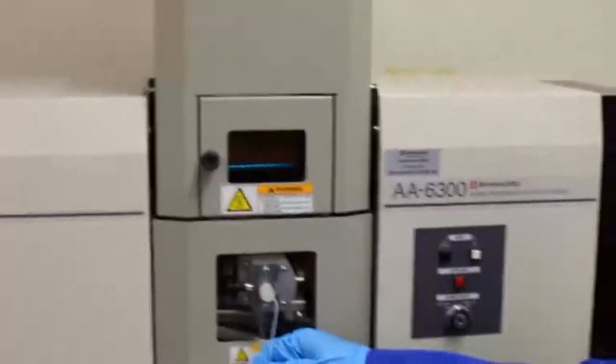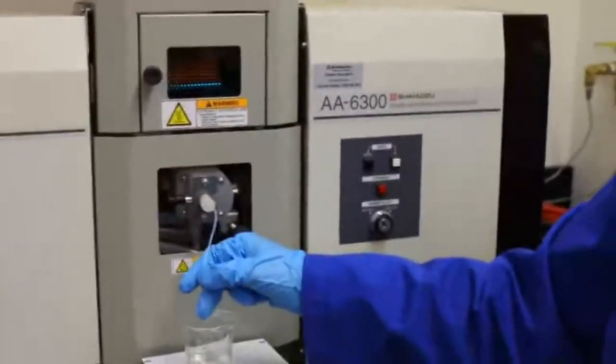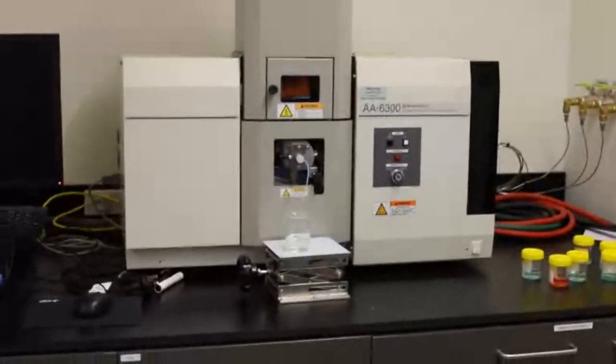All right, so can you remember the colours you've all seen? Do you need to see them once more? Are you all good? It is a pretty cool machine. Is everyone okay? Do we need to see any more colours?